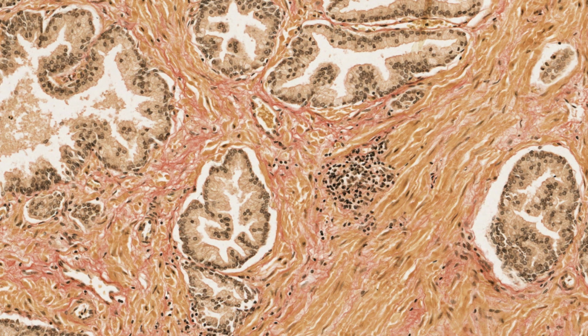And if you look into this image, you can see some epithelial cells that are making the secretory product, but you'll also see yellow stained smooth muscle cells supported by collagen or connective tissue, which stains a pinky red. And that stain is brought about using a Van Gieson staining technique.